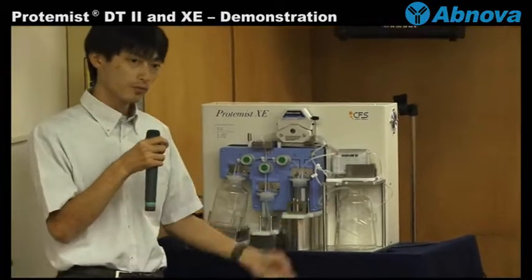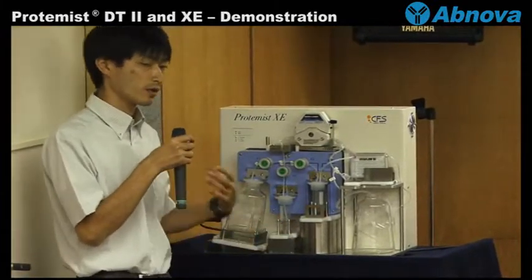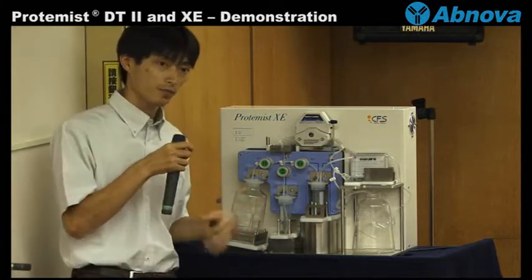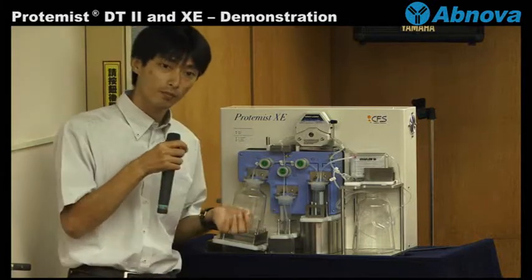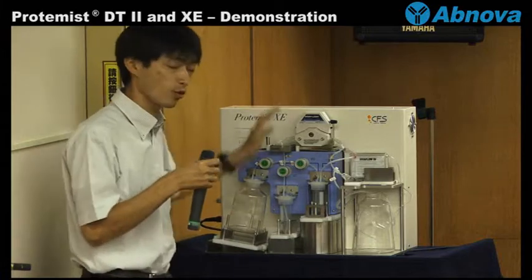After the program, it will start the process for, for example, time duration, bilayer assembly cycle, addition of the mRNA. The process may be complicated but it will do that, so you don't worry about that.